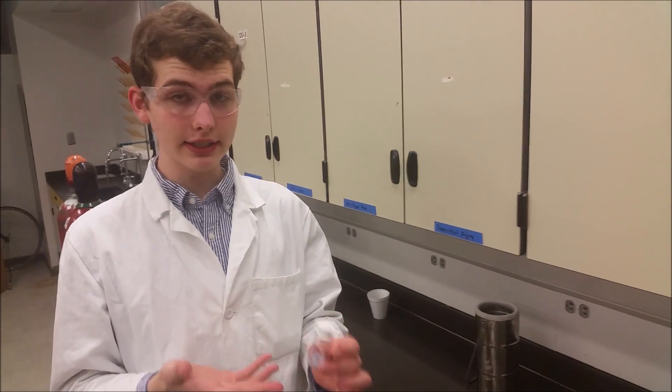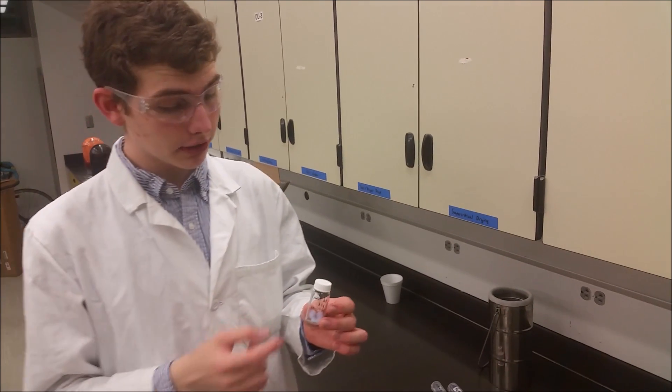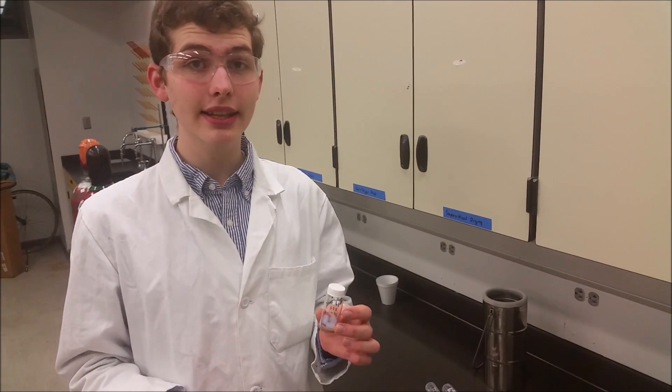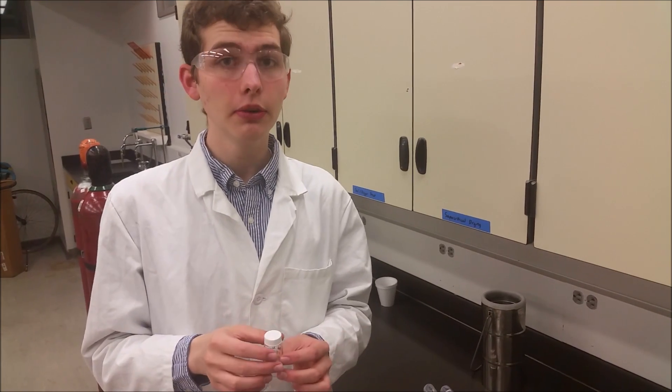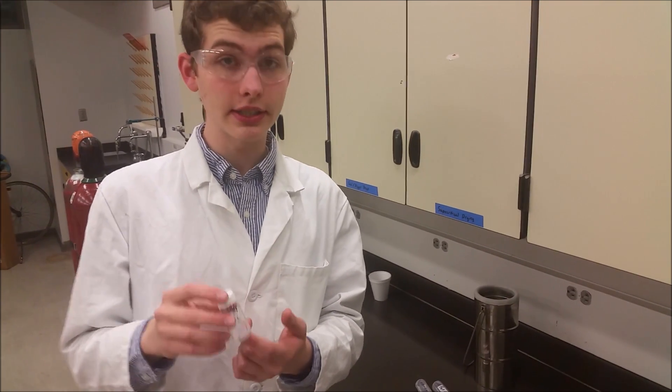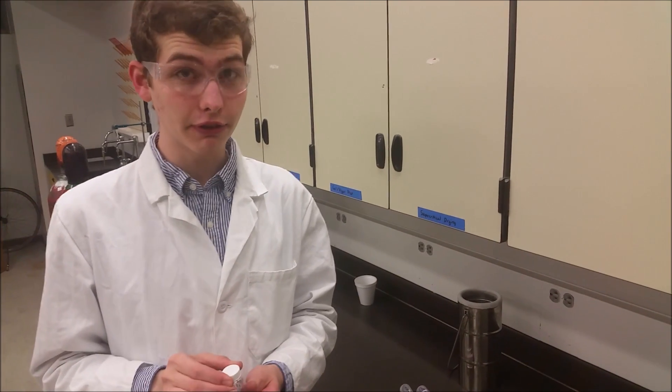It looks about as light as it is, maybe even a little bit heavier. So each of these pieces weighs less than 100 milligrams, which is a very low weight considering their size. It actually is less than styrofoam.